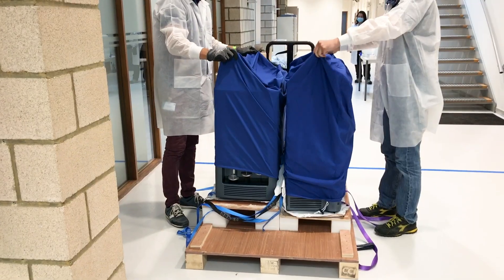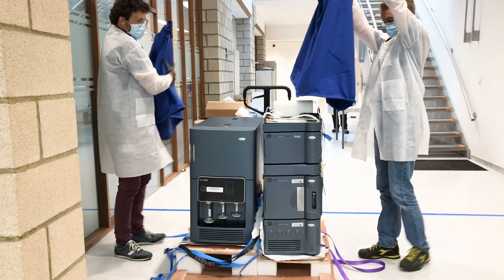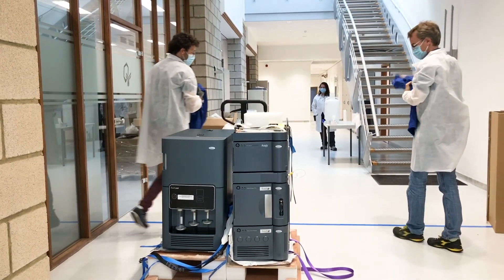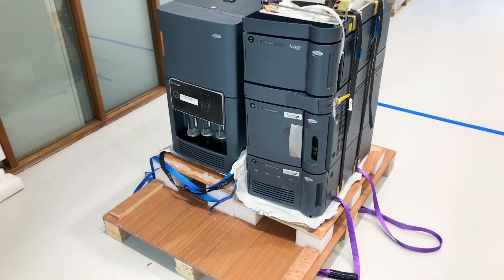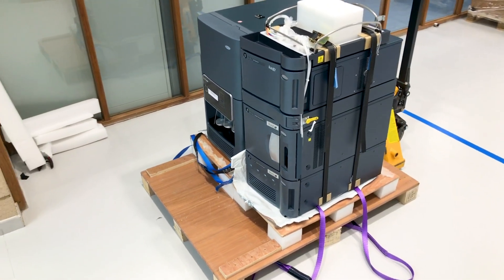You've got your PC, already set up, software installed, your LC is there, all modules are stacked, everything is clamped and connected, the RDA detector is there, the backing pump is there — everything in the same box. The idea behind that is that the BioAccord is really a complete system. It was very surprising to see this LC-MS system arrive in only one box, everything pre-assembled, ready to use, ready to put on the bench and pump down.